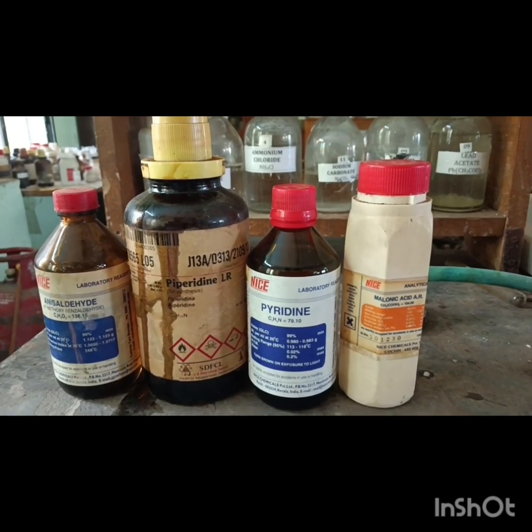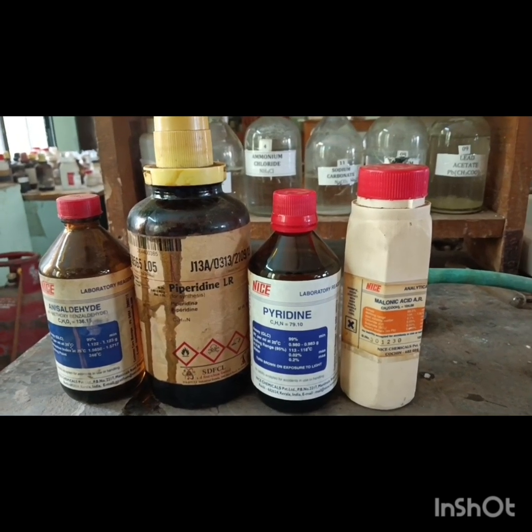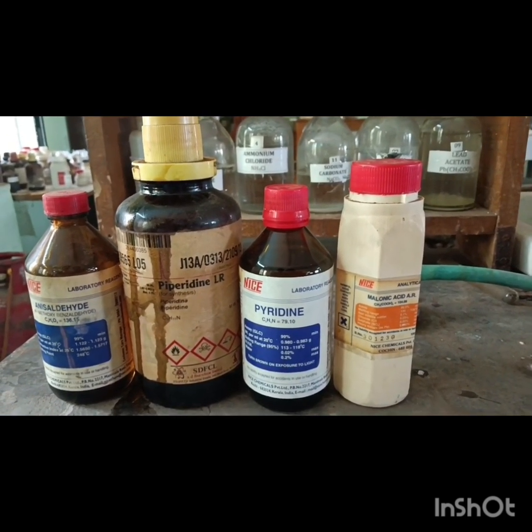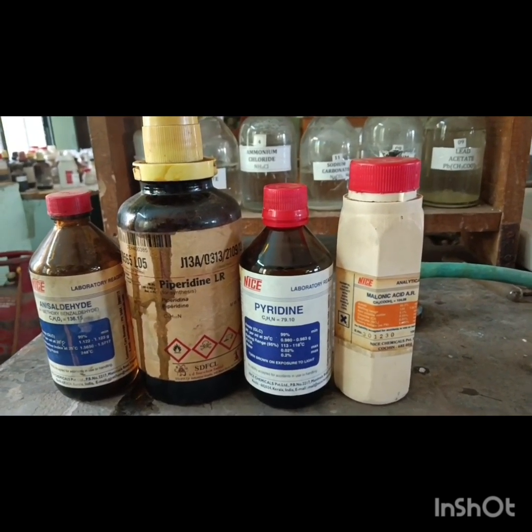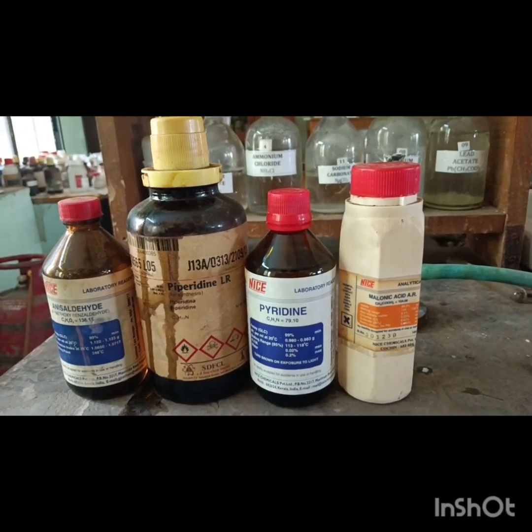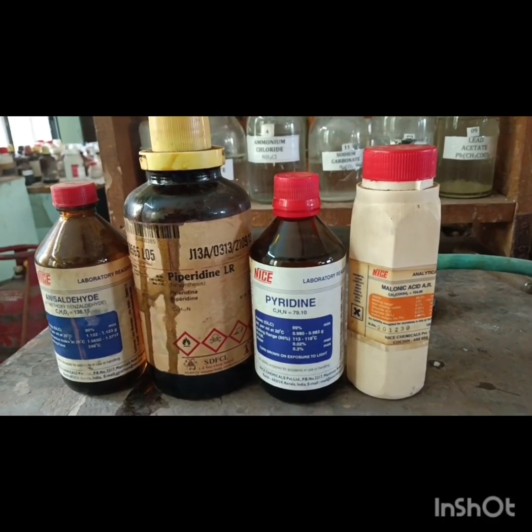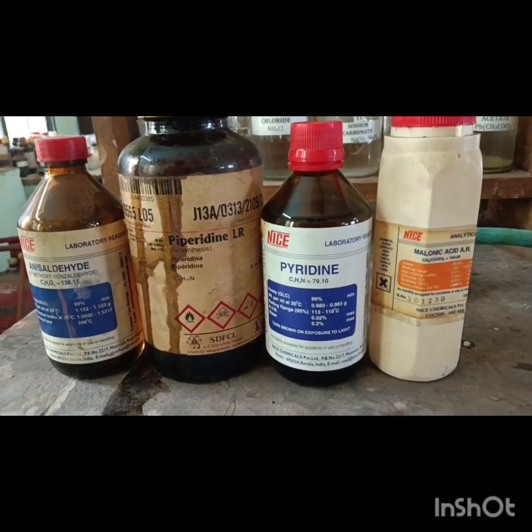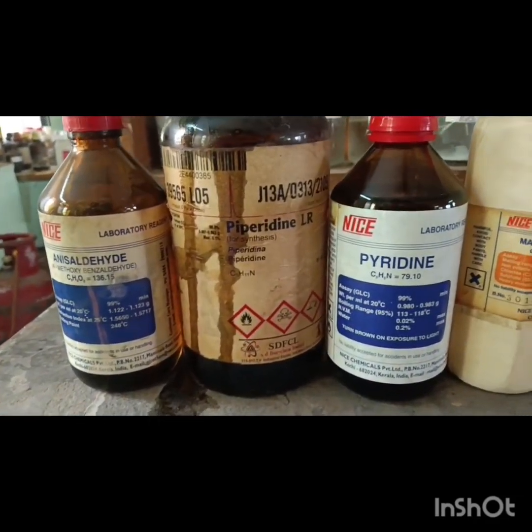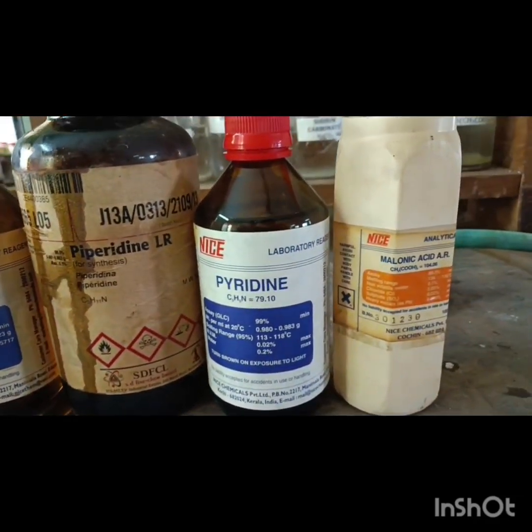Our today's experiment is preparation of P-methoxycinnamic acid from anisaldehyde. The chemicals required for this experiment are anisaldehyde, piperidine, pyridine, and malonic acid.